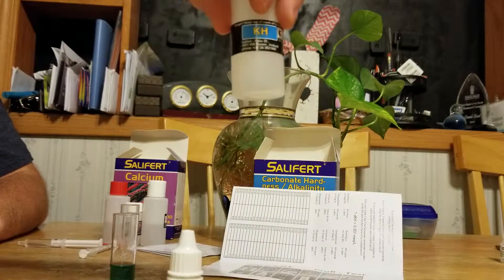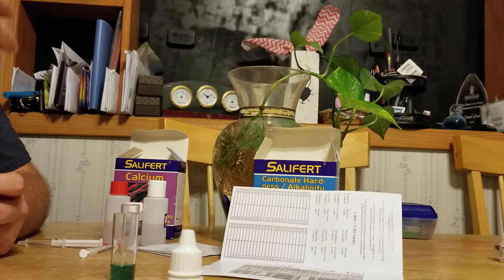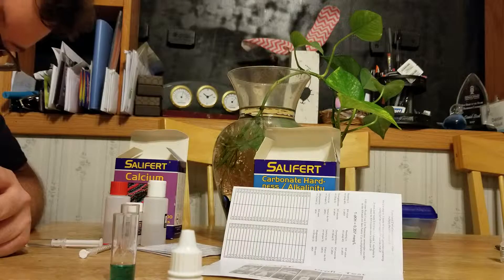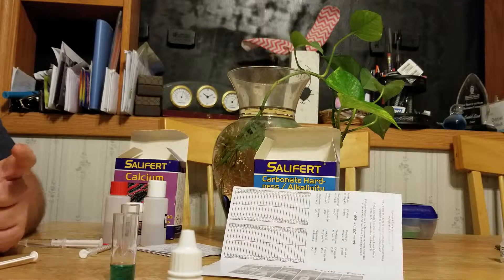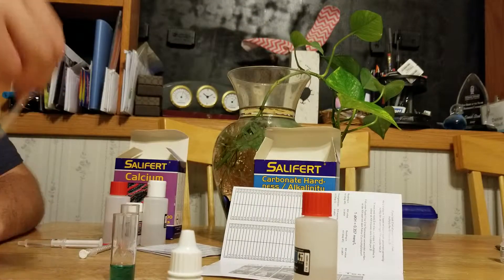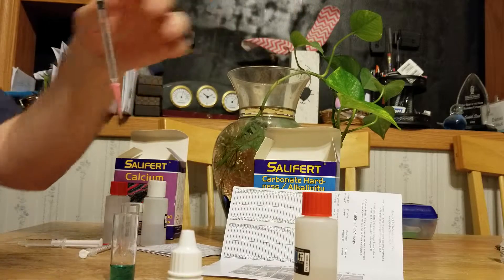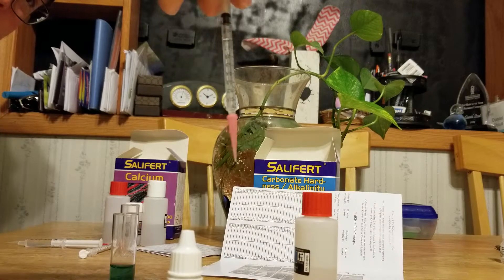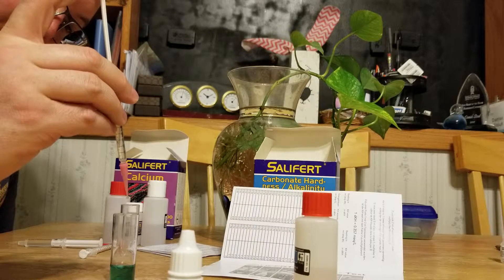Then we have solution number two. We're gonna fill up the pipette with one milliliter of solution — it has to be one milliliter on the dot. How you figure out what KH you're at is by what's left in the pipette. There will be a little bubble because it won't fill up completely. Make sure the black end is all the way up to the one milliliter mark, and then it's gonna slowly drop, adding drop by drop.